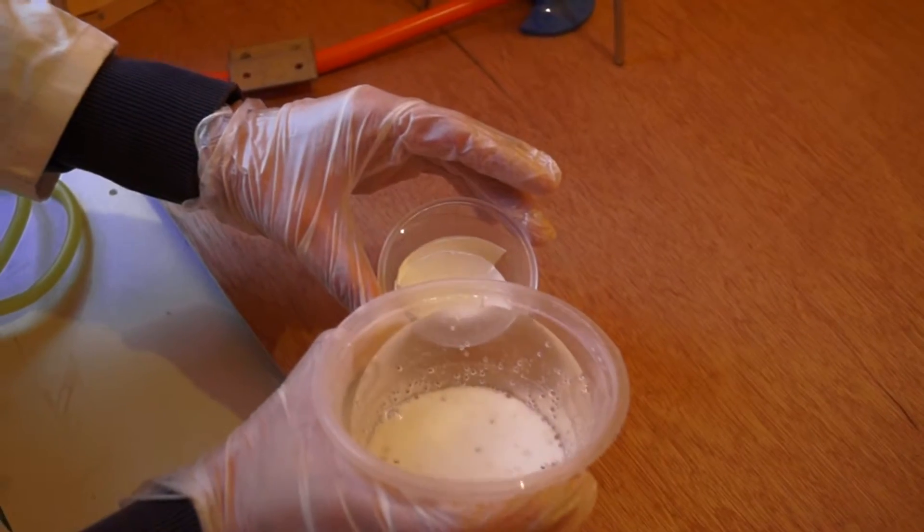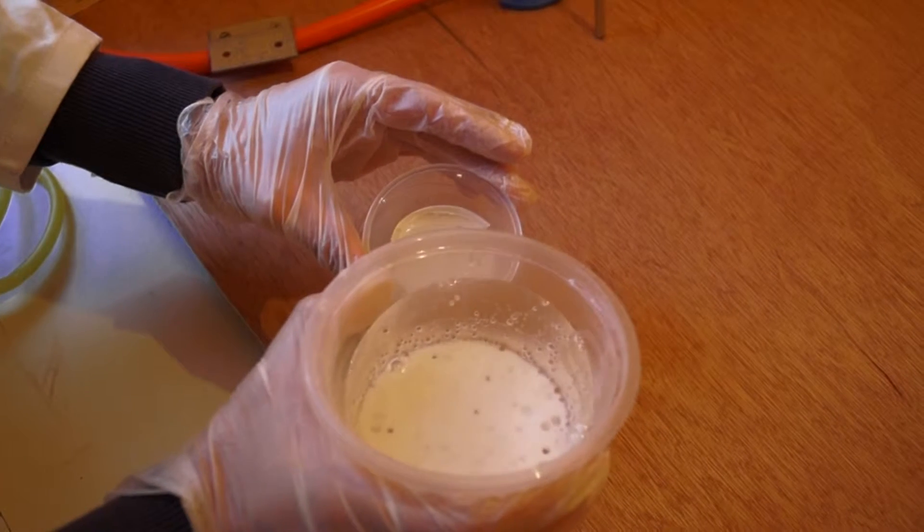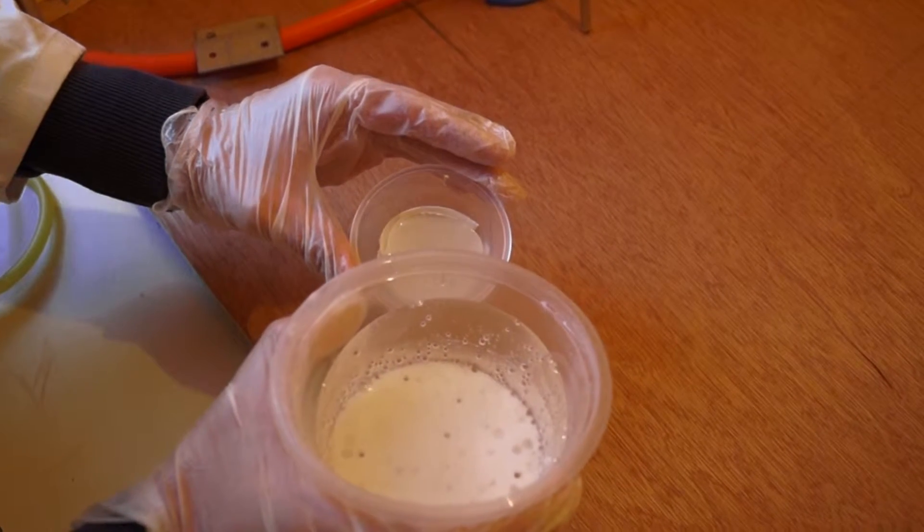Then you should filter the solution to get rid of any excess unreacted sodium bicarbonate.